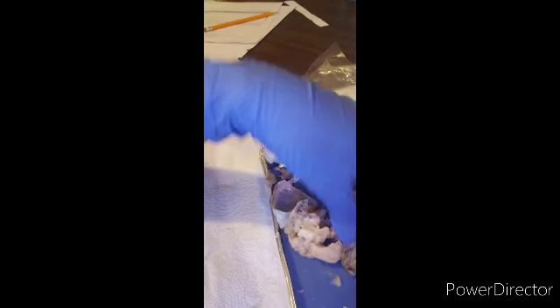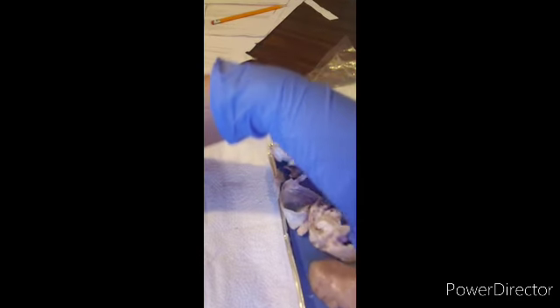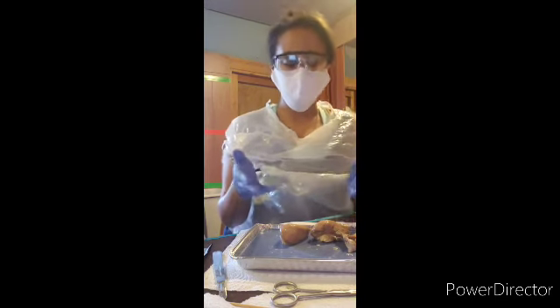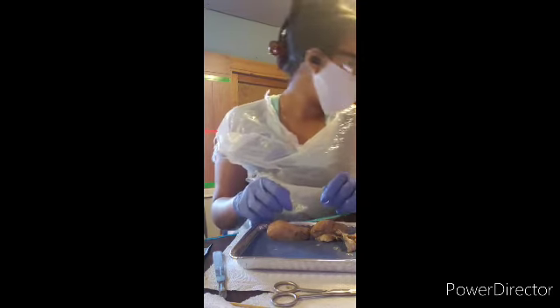But the gray area, which I'm supposed to have a spinal cord, it is a butterfly-shaped section of gray matter and the dorsal ventral roots on the outside of the spinal cord, which this is the gray area right here. But as you can see, I do not have a spinal cord. Now, either I made the mistake or someone cut the spinal cord.